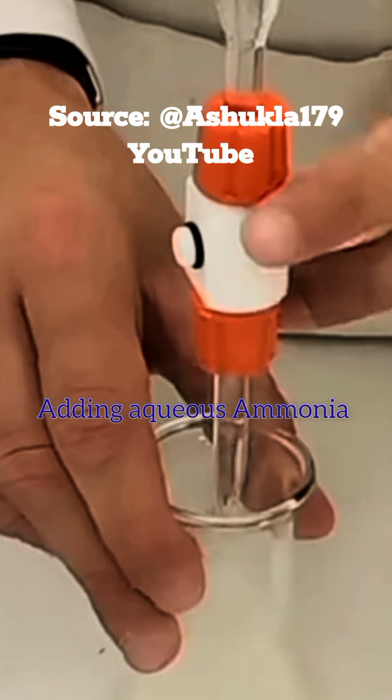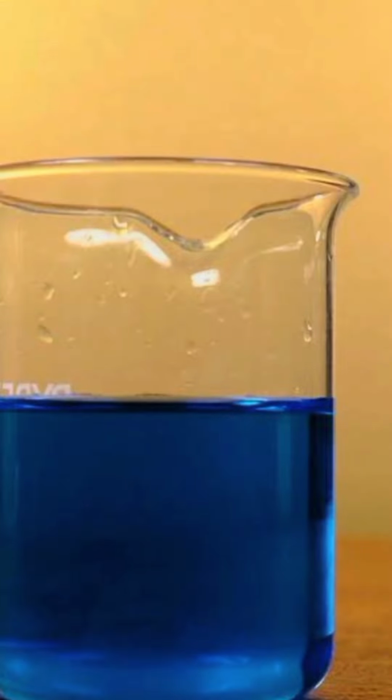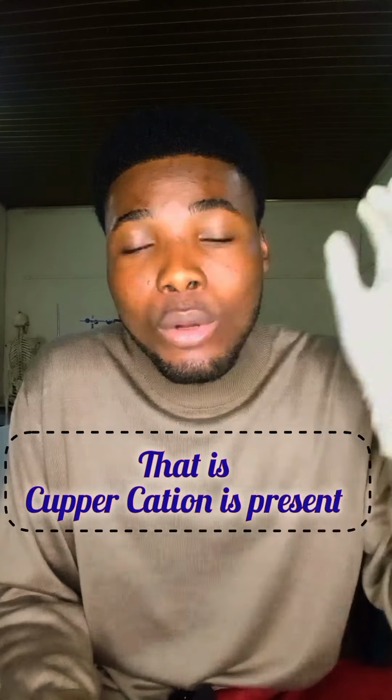Basically, it is a light blue precipitate. I can further confirm if it is really copper ion by adding some drops of aqueous ammonia. The moment I add some drops of aqueous ammonia, it gives me a blue precipitate, and if I add the aqueous ammonia in excess, the precipitate dissolves to form a deep blue solution. That confirms that the cation present in this salt is the copper cation.